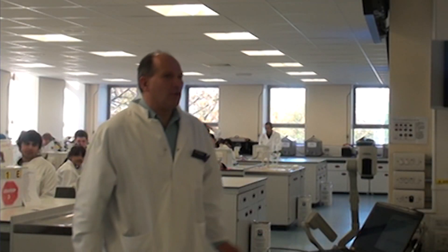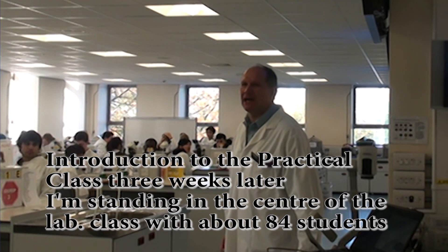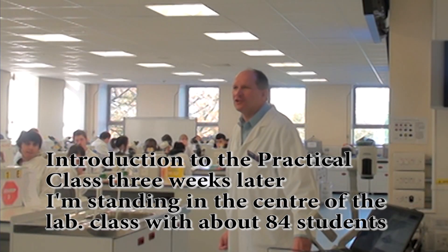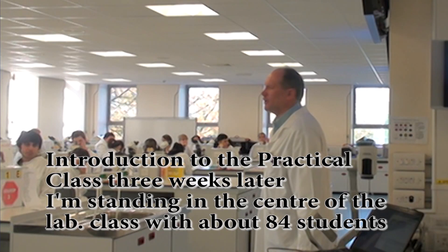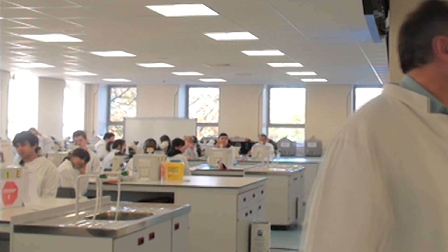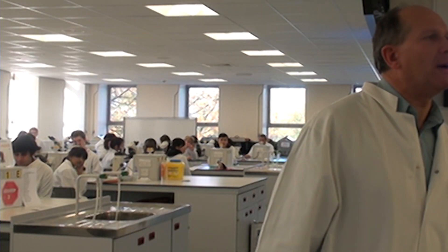Today we're looking at the cultures which we set up on the very first week. Most of them grew pretty well, and you're going to be using during this practical the microscopy skills which you've learnt in the two intervening practicals. Remember all of the points you were taught there: setting up the microscopes, looking at detail, making quantitative measurements, always making sketches to show exactly what you're seeing, and using scale bars and labelling things.